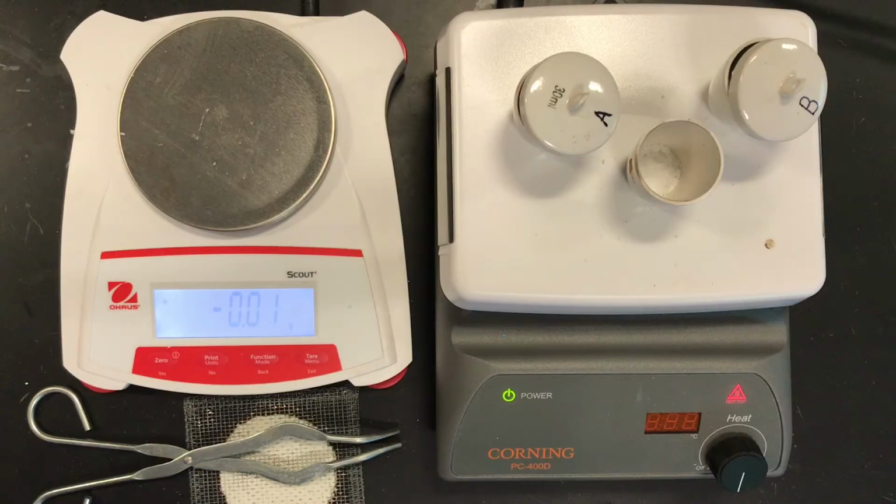Now, I don't know if the video is picking this up, but you can clearly hear the sizzling going on. Hear that sizzle? Yeah, that's the water escaping the crystal right there. So you can hear that kind of boiling or sizzling as we add heat to the hydrate. The water, which is attracted to the positive and negative ions in the crystal, is now being separated out and evaporating away.